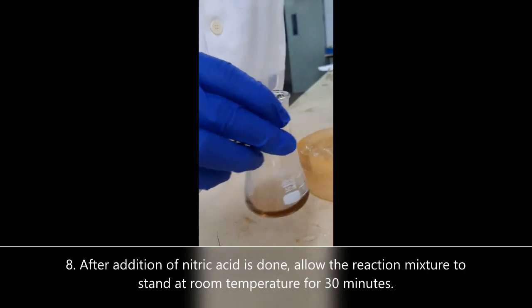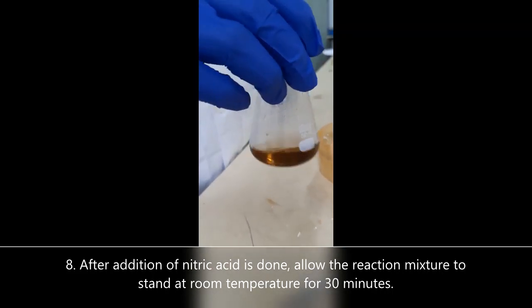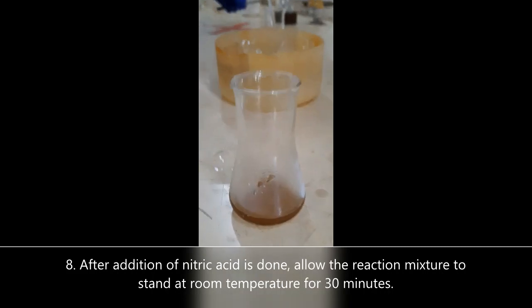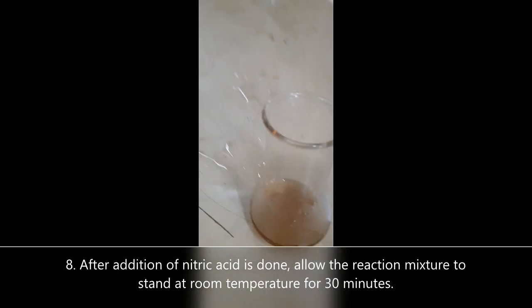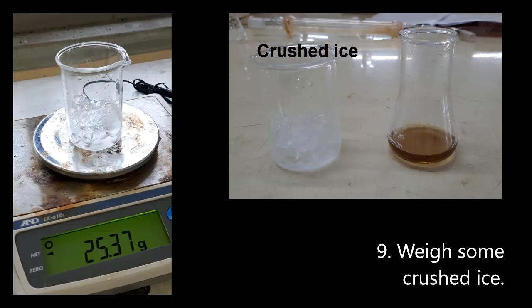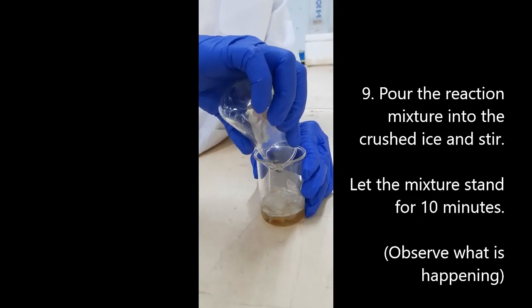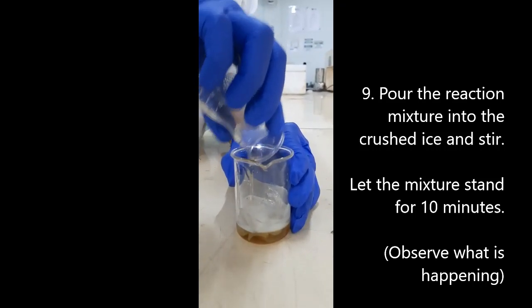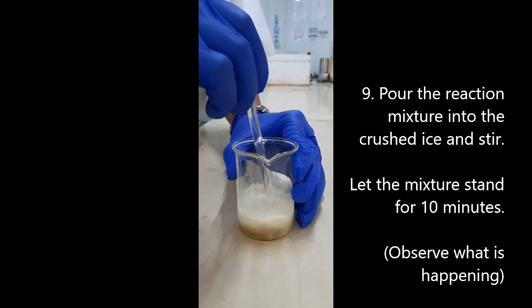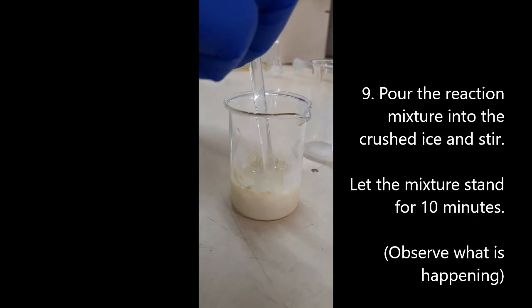Once all the acid has been added, take the conical flask out of the ice bath and allow the mixture to stand at room temperature for 30 minutes. Weigh the amount of crushed ice needed for the next step. Pour the mixture into a beaker containing crushed ice and stir using a glass rod. Rinse out the flask with a small amount of distilled water containing some ice. Observe any changes that happen, then allow the mixture to stand for 10 minutes.